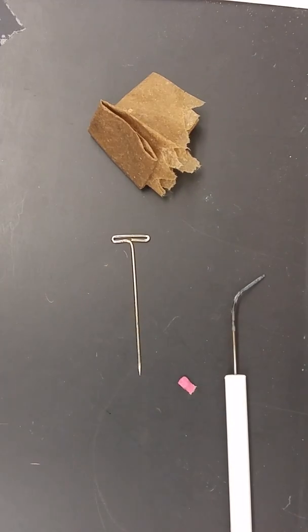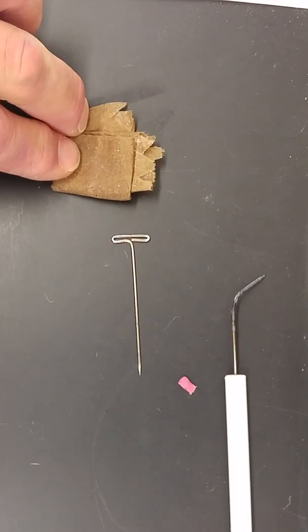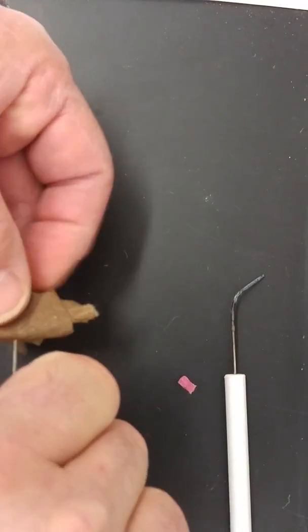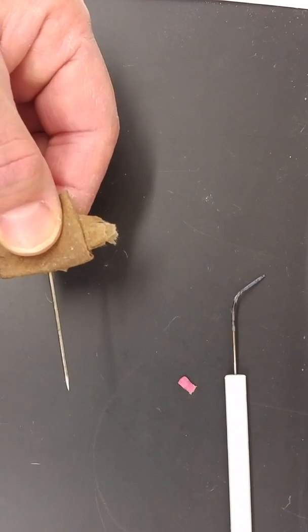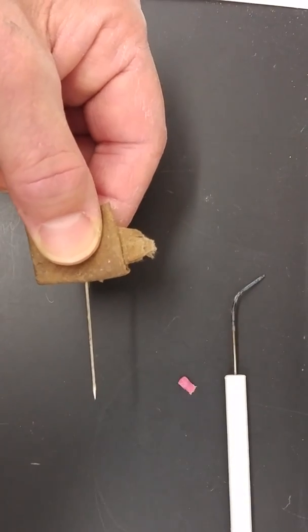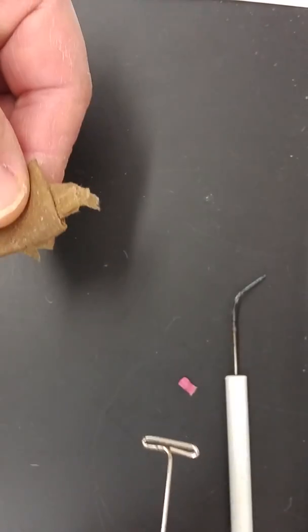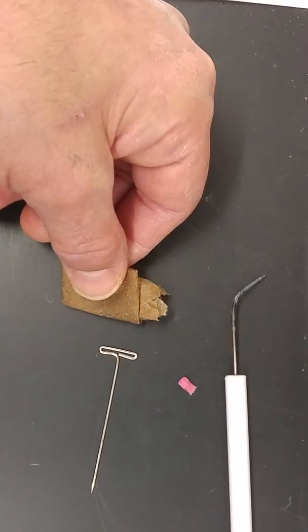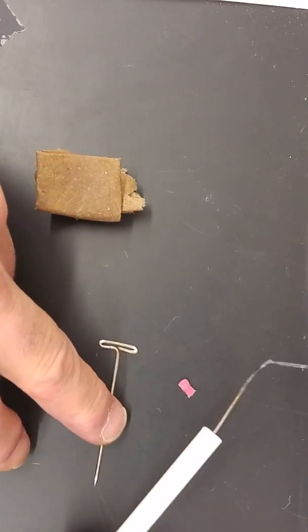If you use a dissecting pin you will want to use a wet piece of paper towel so you can hold it safely when you're using the flame. I would generally avoid trying to use tongs to hold these dissecting pins because the tongs will drop them. So you can use this or you can use the dissecting tool.